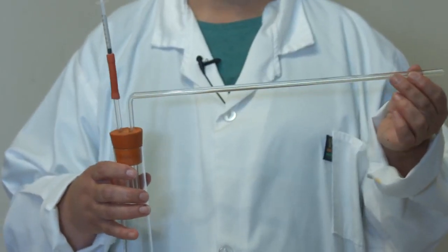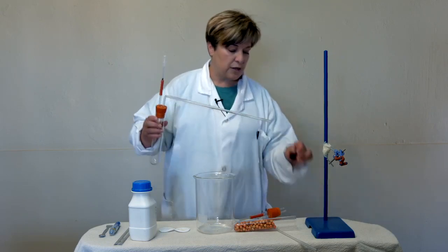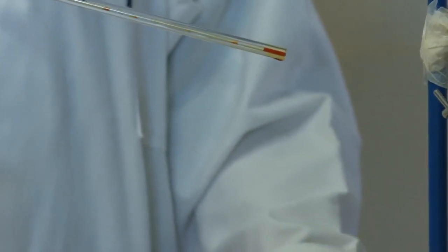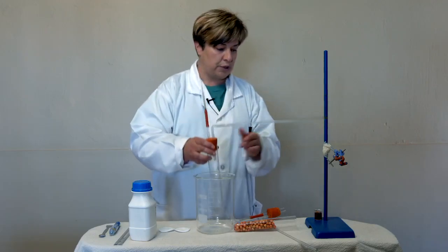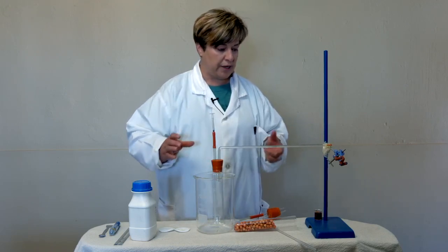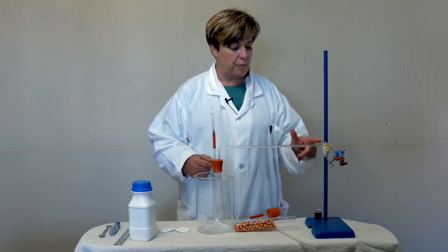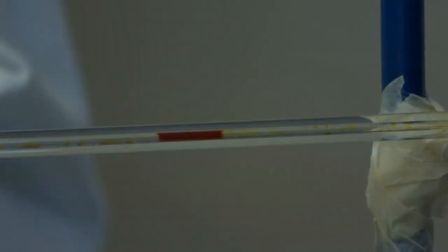It is a capillary tube, which means that if we fit the lid correctly, it will take some of this red fluid up by itself because it is a capillary tube. And there you can see the red fluid. And then we are going to put it down. This is our control. It might need some time to equilibrate. If there are any changes in temperature or in the air pressure, this red bubble, which is just water and food coloring, will start moving.